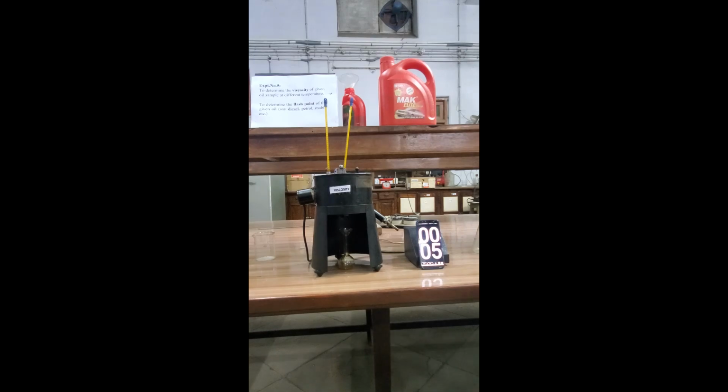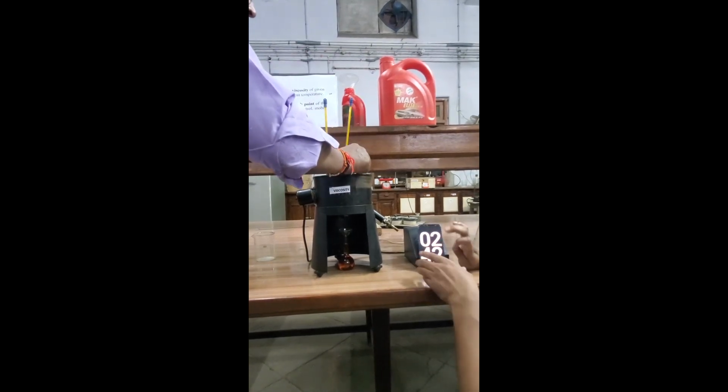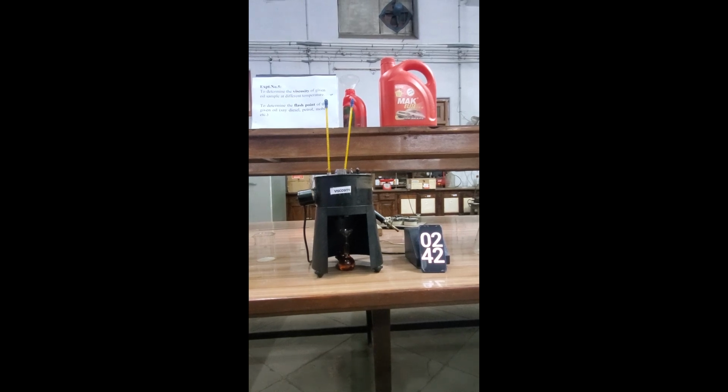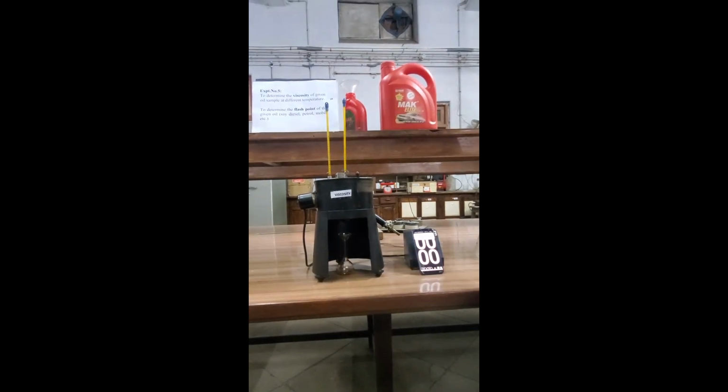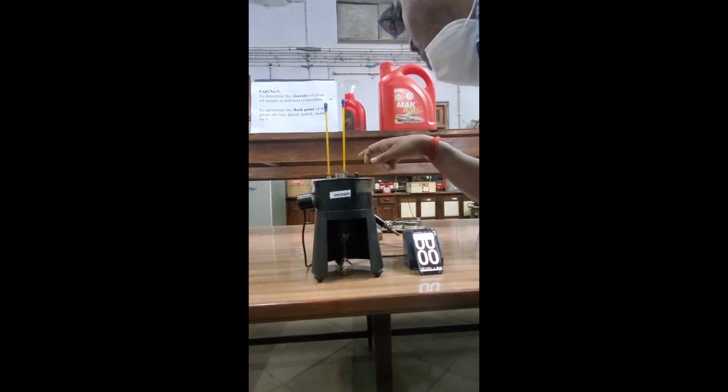Start. Stop. Now the temperature is 47. The temperature of the water is also 47.